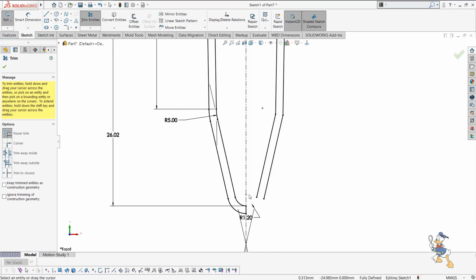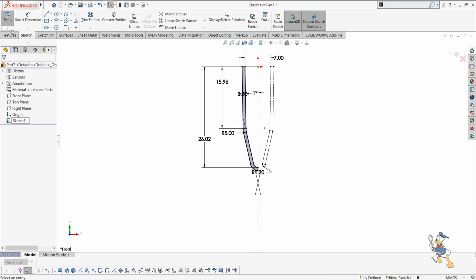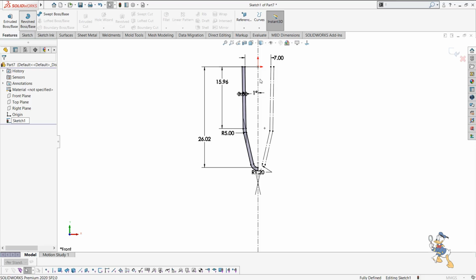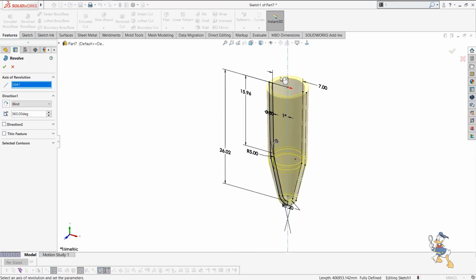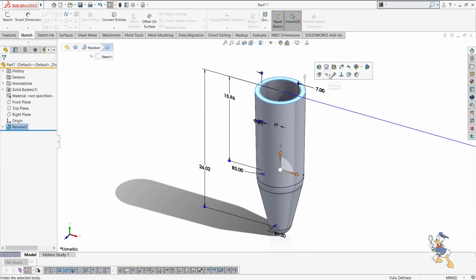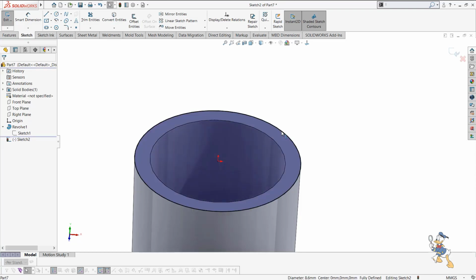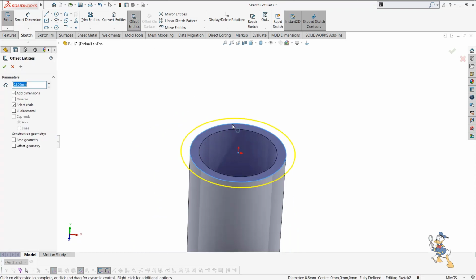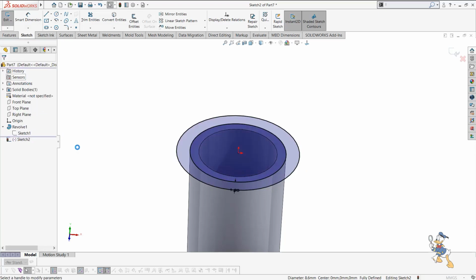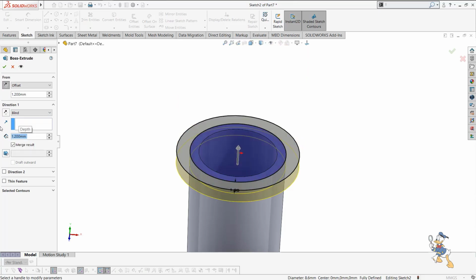then I just need to trim this one, and after trimming this one I can make it construction, and after making it construction I just need to revolve this feature about the center axis, and after revolving this one I can generate a plastic component easily. So after generating this plastic component, I can generate some sketch, and I can offset the value up to about 2 mm or 1.2 mm, and then I can extrude it up to like 1.2 mm offset value, and with the value of 1.2 mm.